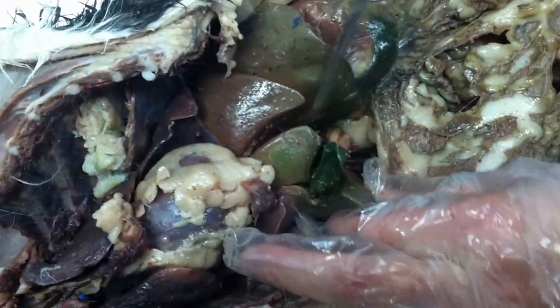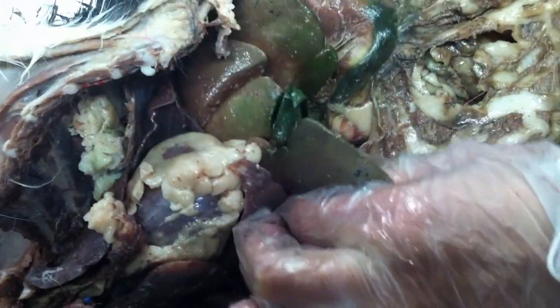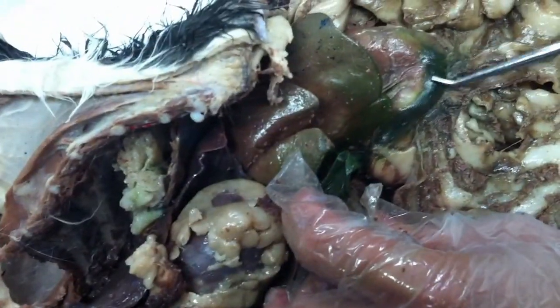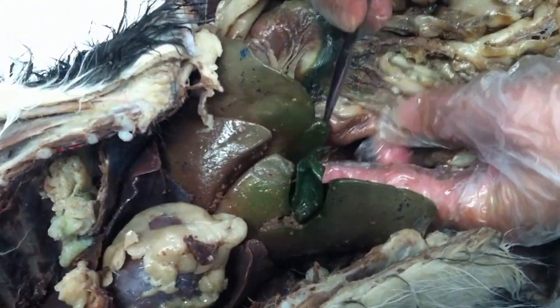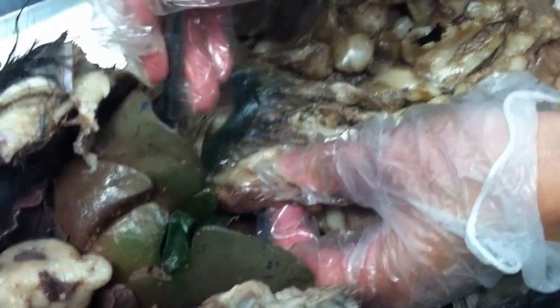And here we have the gallbladder, the green thing. Yes, that's a giant gallbladder in there. And look at this, that's a part of it, right? Today, that's what I'm asking you to do: please dissect this out a little bit more. These ducts, okay?